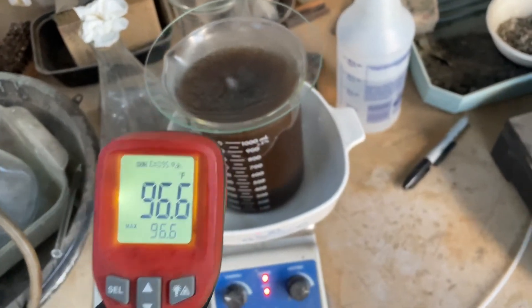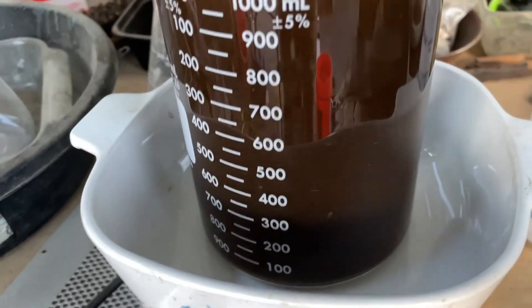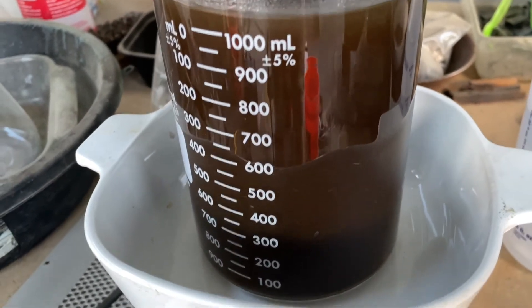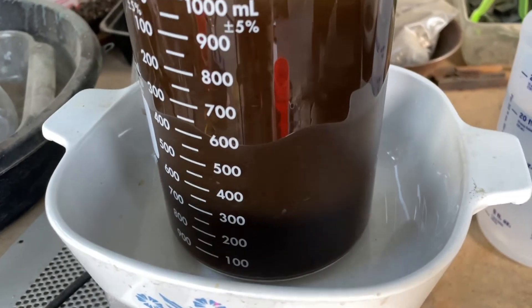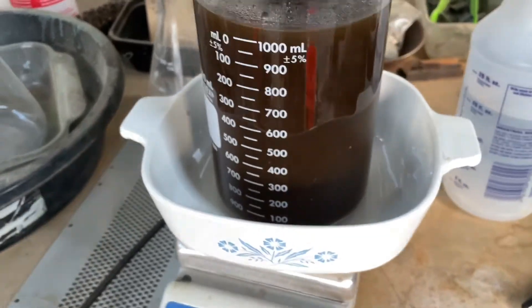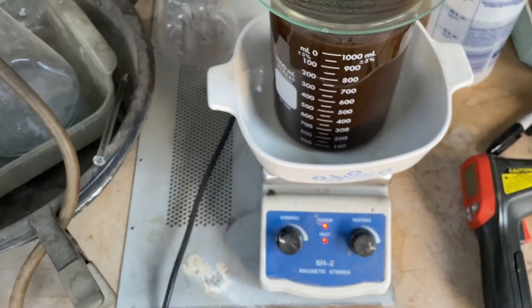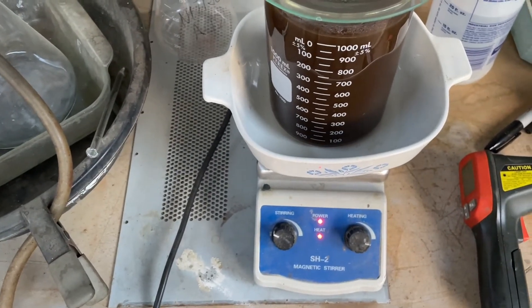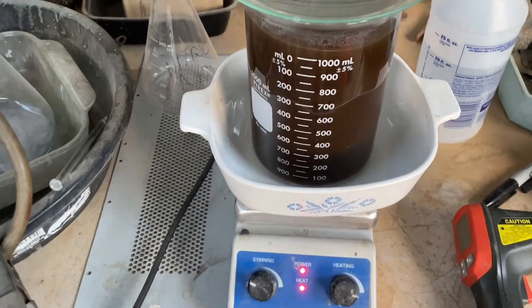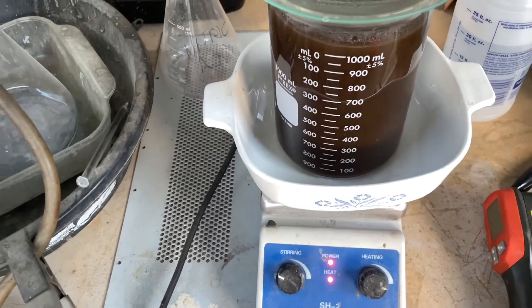Okay folks, we got it up to about 96. You can still see stuff in there for sure. But anyway, that's why you get sludge at the bottom when you're done. So I'm going to turn it off and just let it settle overnight. Let's see what it looks like in the morning, then hopefully get off all that sludge and have a nice clear solution to work with and put it to work on some of that gold. Woo!